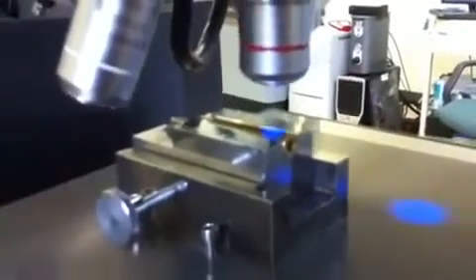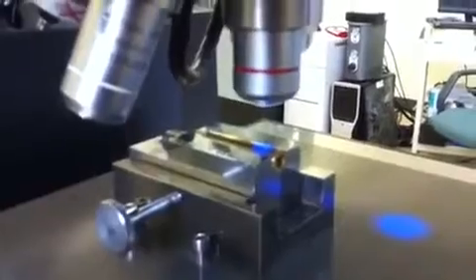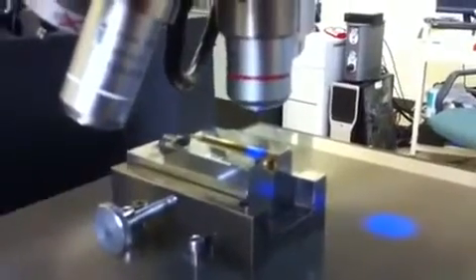This is the frame. You can see we have a bullet shell — a single bullet shell fixture in position, an ammunition shell mounted in place. This is what the shell looks like.